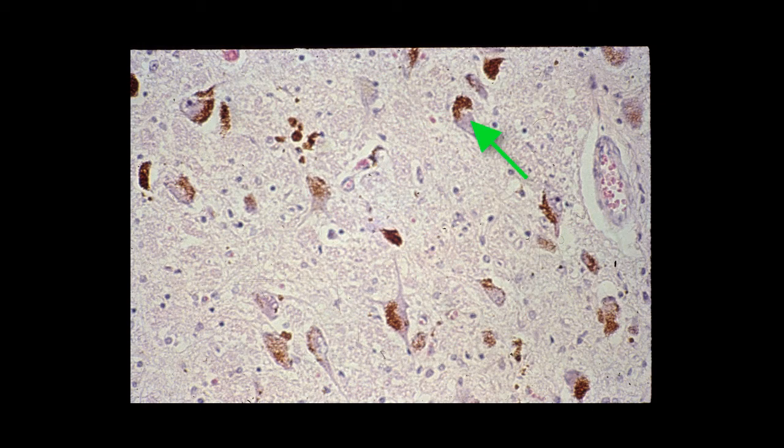This particular cell is just meant to demonstrate the pigmented neurons. I'm not going to ask you to locate what specific region in the central nervous system these happen to be found within, but you can clearly see the neurons with melanin granules within them. Here are some blood vessels that you can see in this region of the central nervous system.